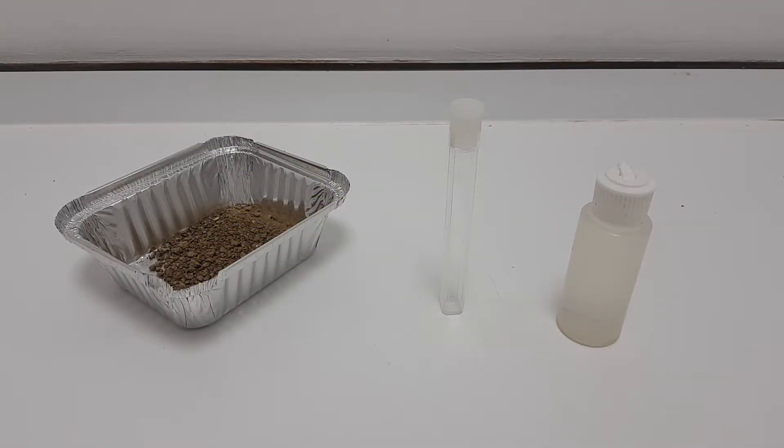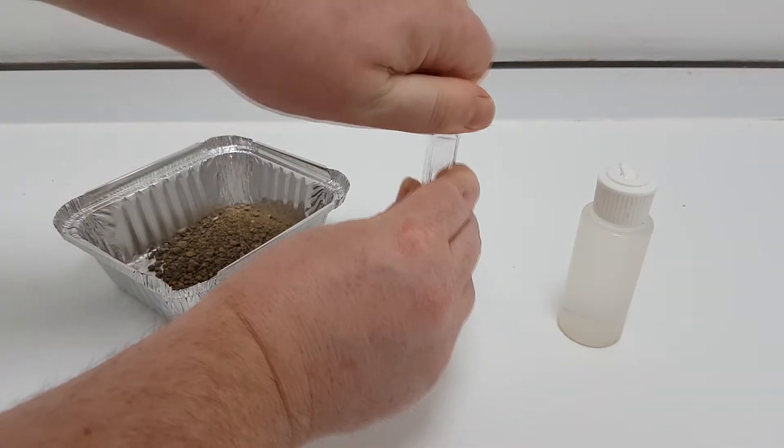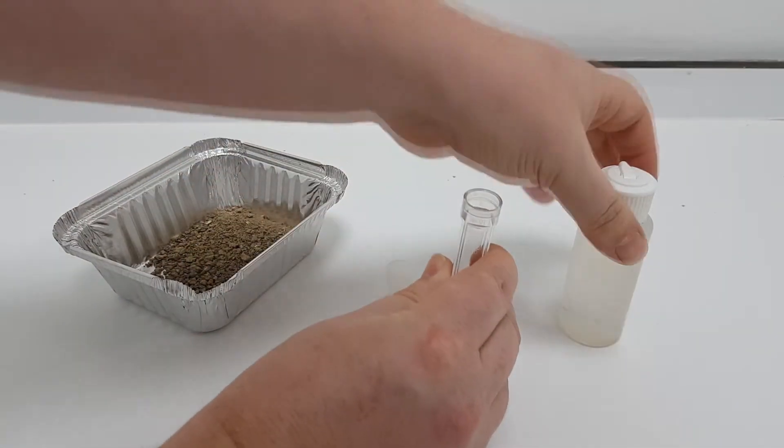To get started, open up one of the test tubes and fill it to the 10ml mark with distilled water.